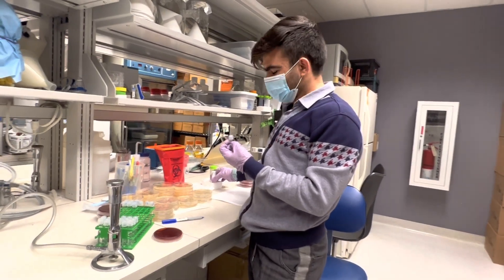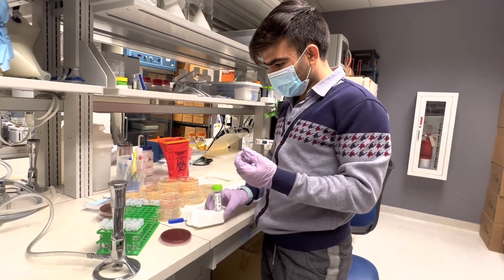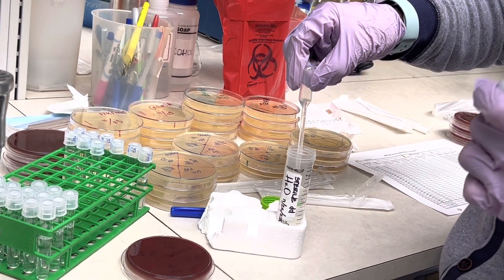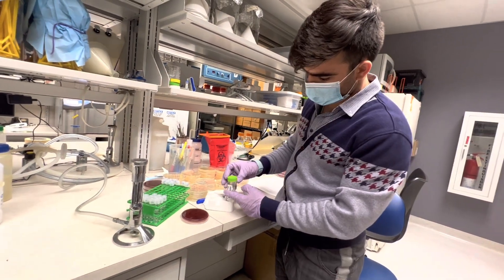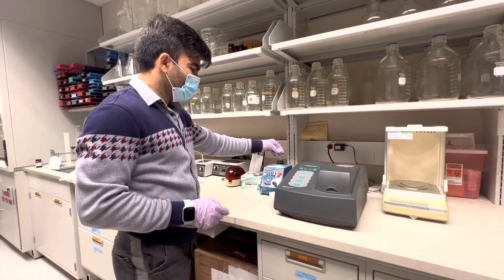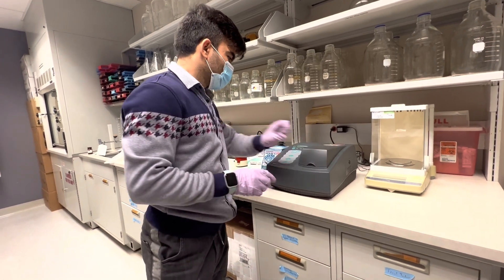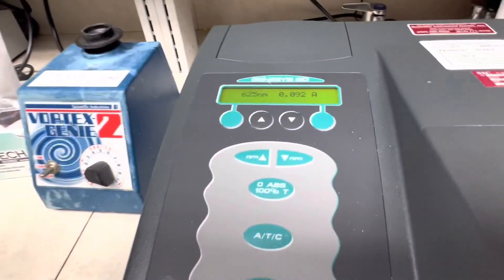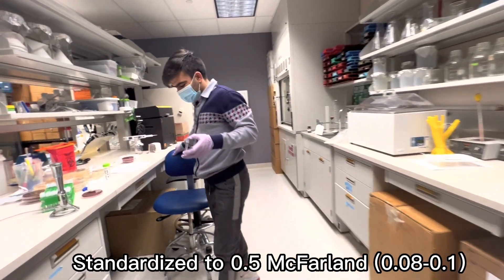So when the bacterial concentration is higher than what I need, I should dilute it — I should add distilled water. These are double distilled water. I add some water and vortex again. Right now you can see that the turbidity is 0.092, which is within the range we want. So that is okay — the bacterial concentration and turbidity is now standardized.